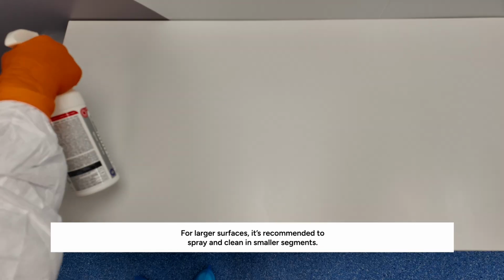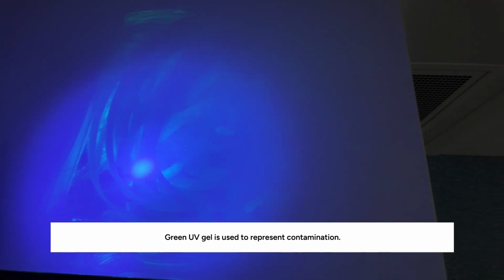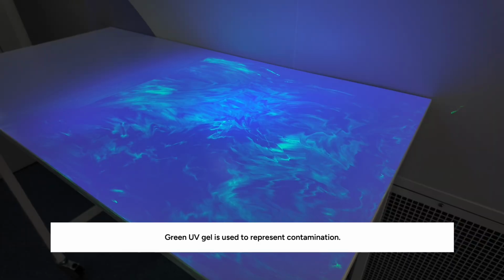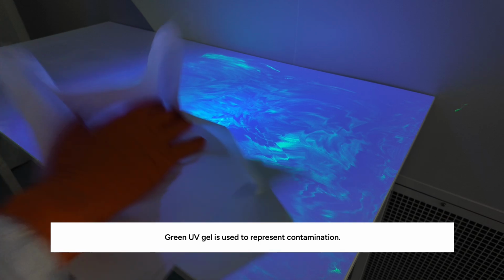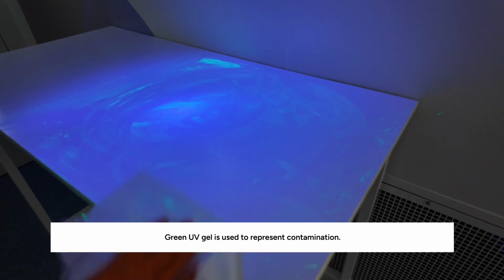If you notice that your surface starts to dry, you can apply more of your chosen chemical. Cleaning technique makes a huge difference with removing contaminants. Cleaning in a circular motion, maybe like we would at home on a kitchen surface, just spreads the contamination around and doesn't actually remove it from the surface.